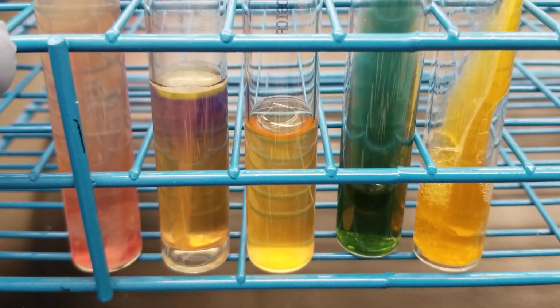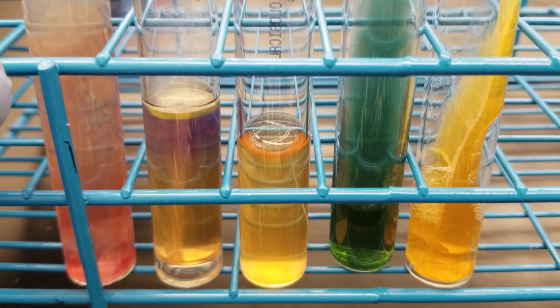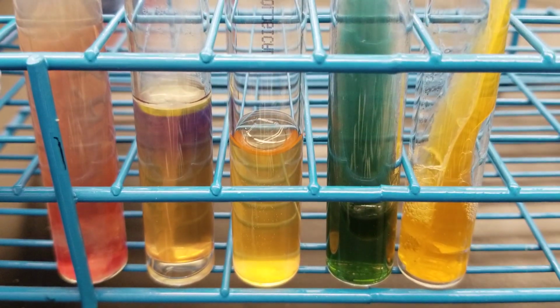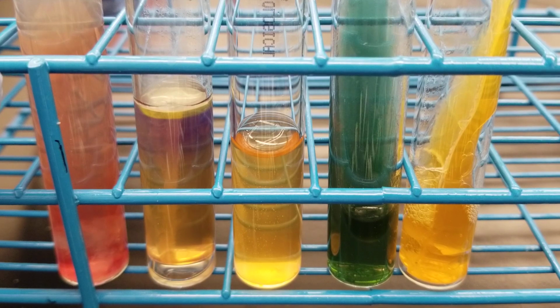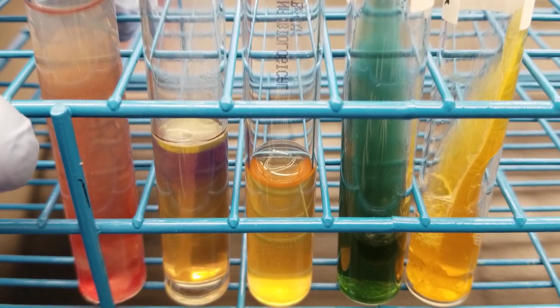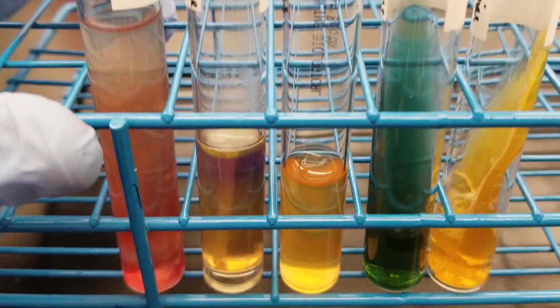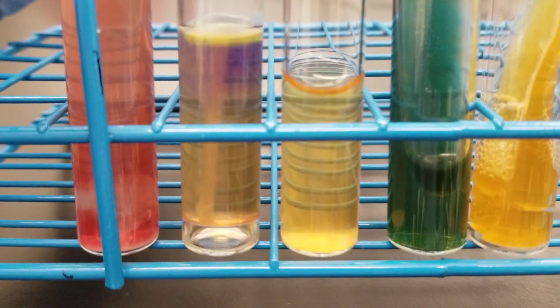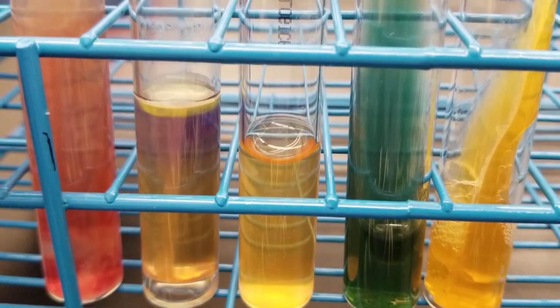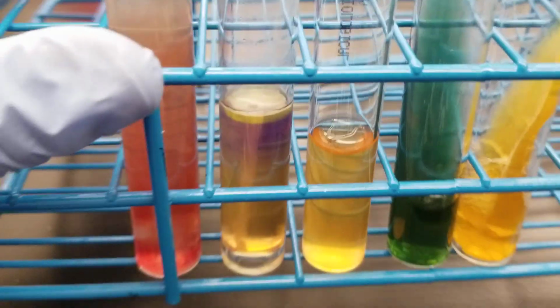So this is Klebsiella pneumoniae. Everything is characteristic. That blue in the citrate tube is kind of faint, but it's there. It looks a little more green, I think, on the camera than it does in real life. In real life, it has a beautiful blue. It's not as blue as some others, so be careful about that. And notice underneath here that the gas is showing up in the MIO tube as well. Okay, at the bottom here, it has been lifted.